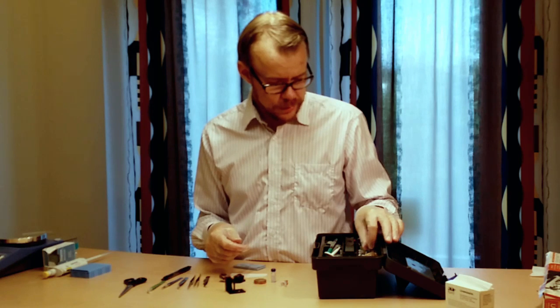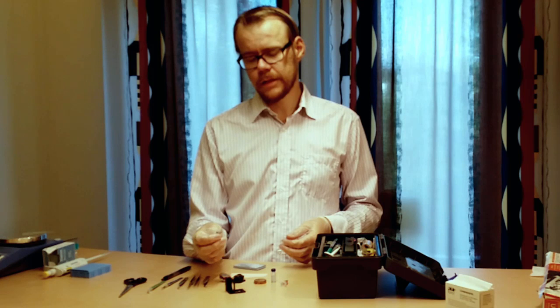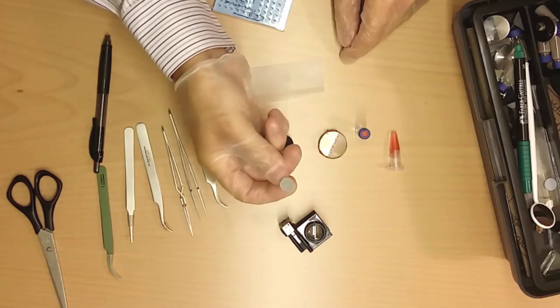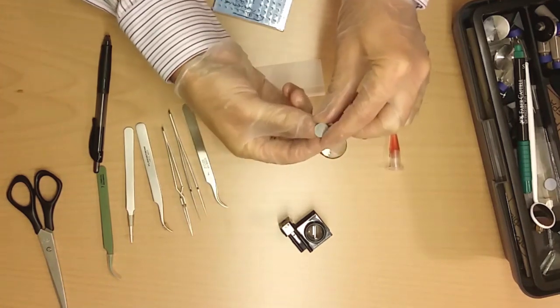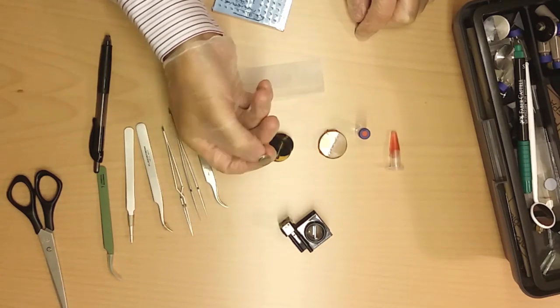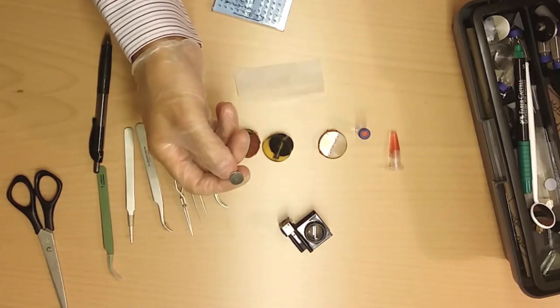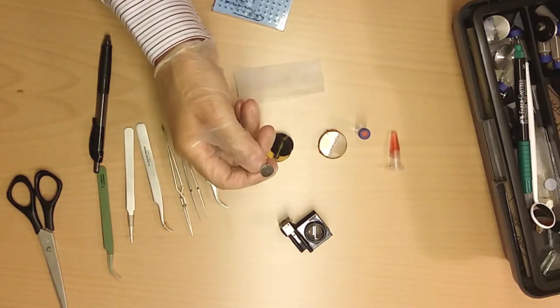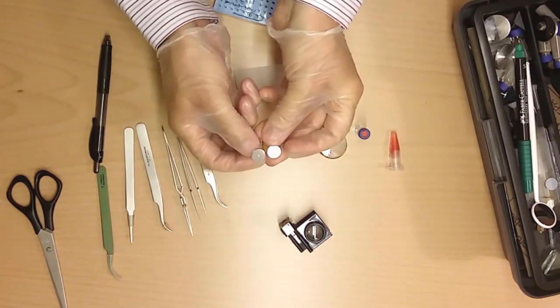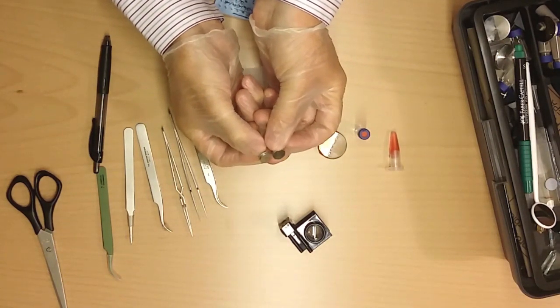Sometimes you can just put your liquid thing that you want to study in the SEM. You can just put your suspension directly on top of this. Very handy. And you can see that this is very glossy and mirror like. And that is because I polished it. You need to polish it if you want to use this method. Otherwise the original one. Let's see if I have one of those. Here is an original. It is too rough in the surface to make it of any great use.